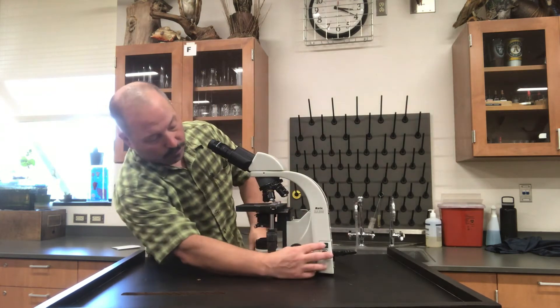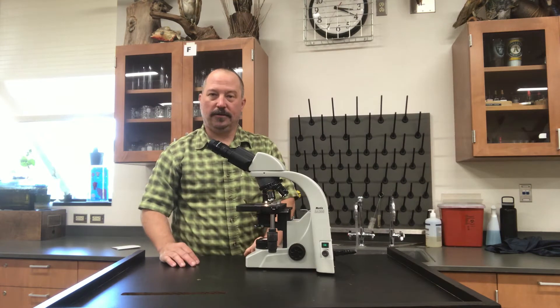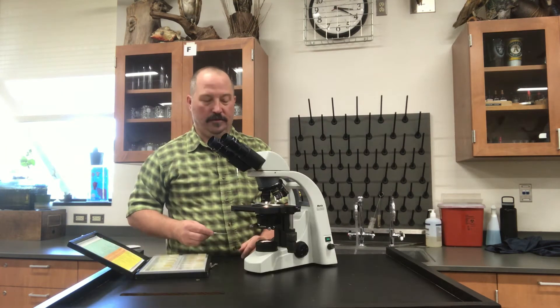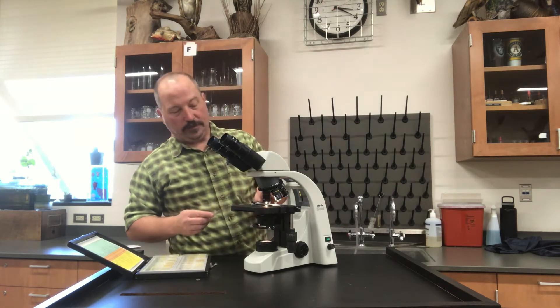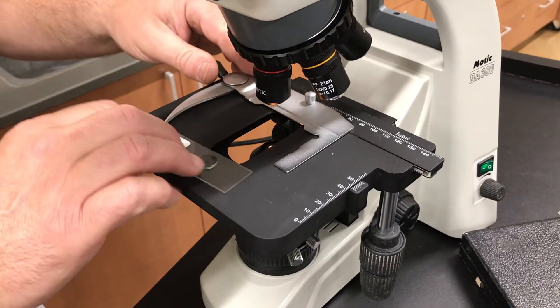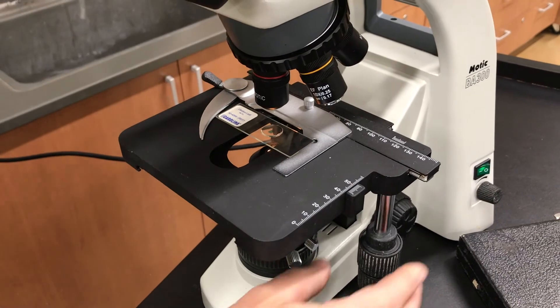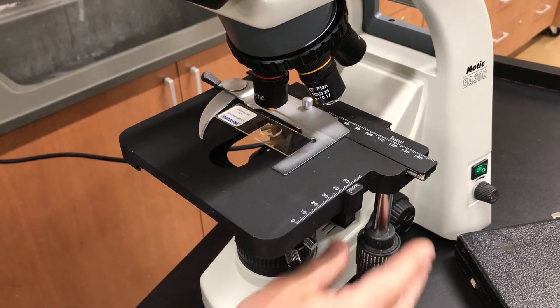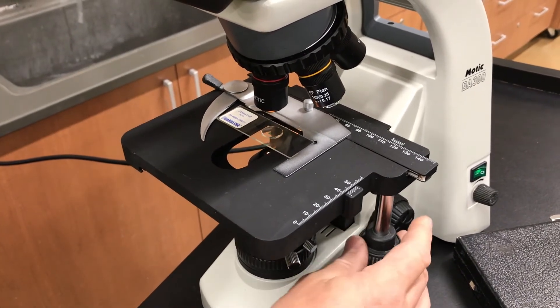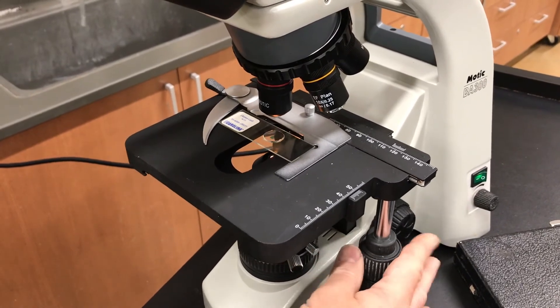Then turn on your light. That's where your light goes. Let's get a slide. When you get a slide, this is the stage clip right here. You'll open it up and put the slide all the way to the upper right and close the clip. This then allows you to move the slide to look all around it, either up or down with this knob right here.